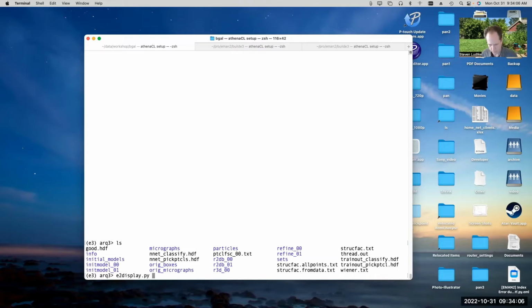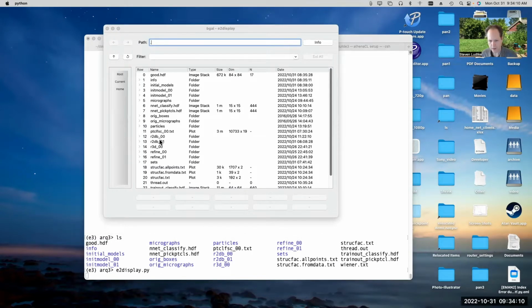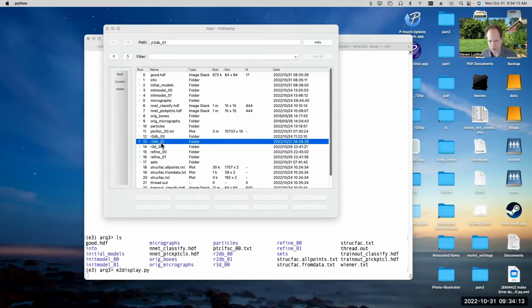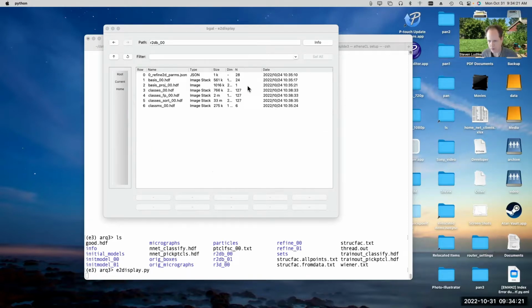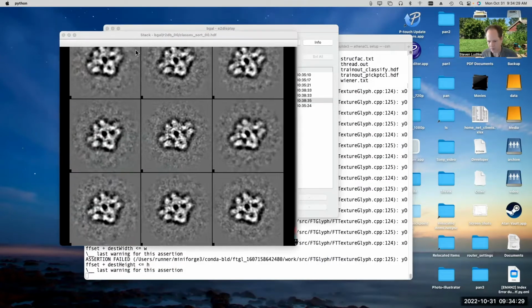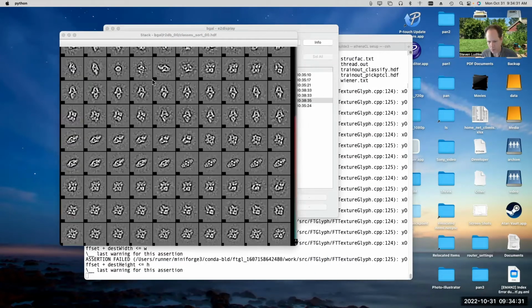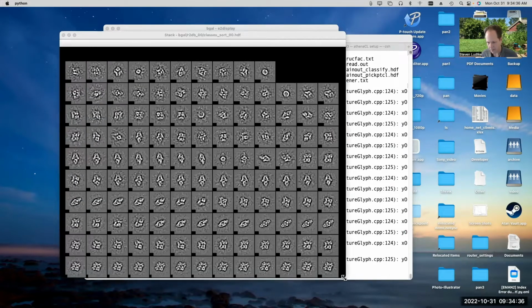So let's just do E2 display. And we can take a look at my R2DB and R2DB01 folders. Now, if we look at R2DB, this was run with the full resolution particles. So if we look in here, we'll see that we have 256 by 256 particles in our class averages. And if we double click on that, we can see these particles. I'll shrink it down so we can see more of them at a time. And you can see it did a fairly nice job.